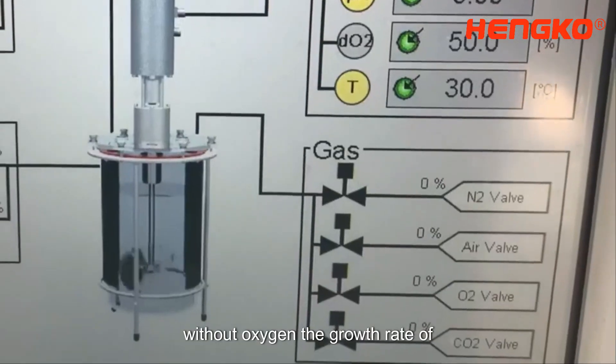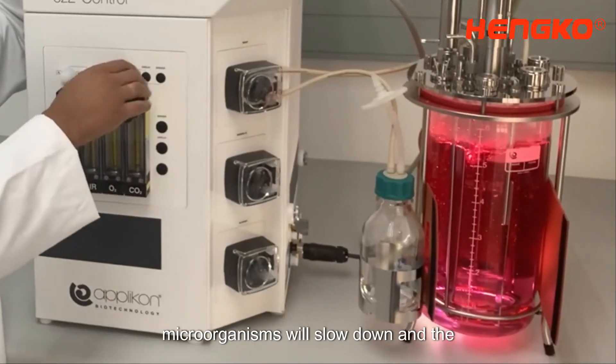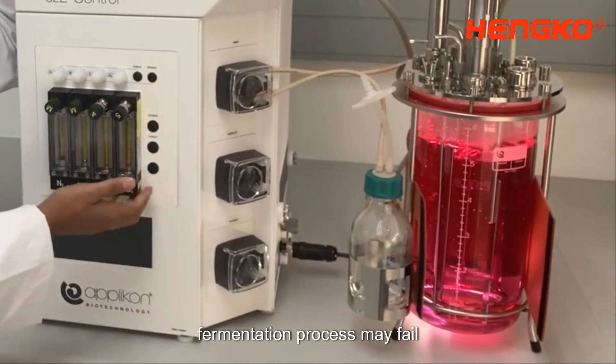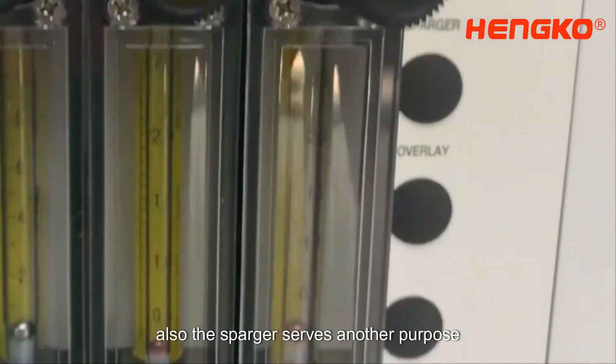Without oxygen, the growth rate of microorganisms will slow down and the fermentation process may fail.